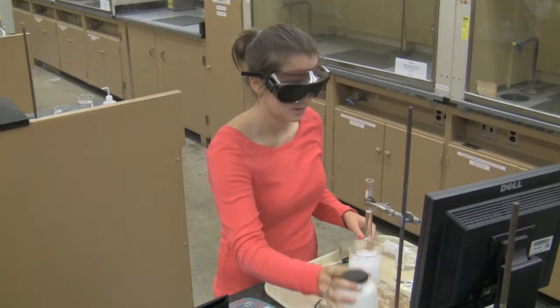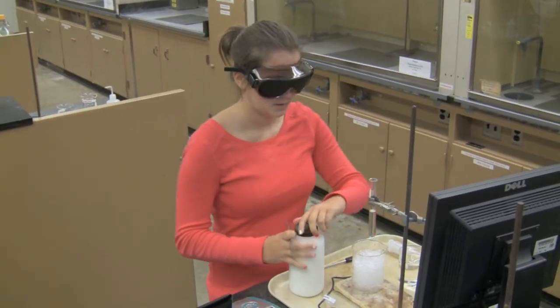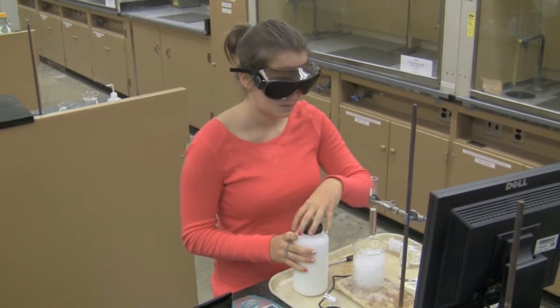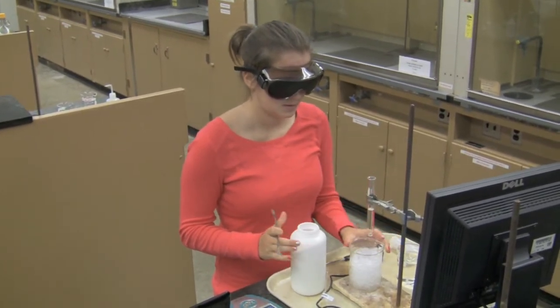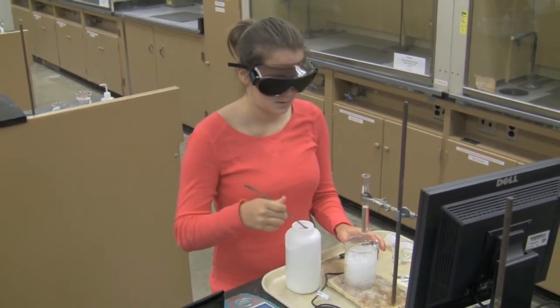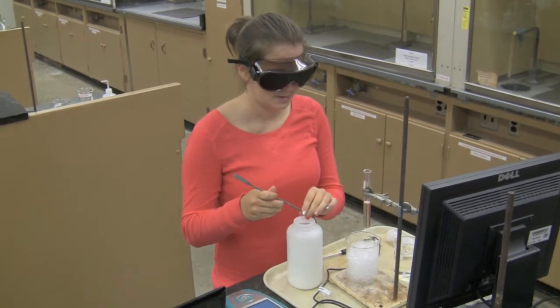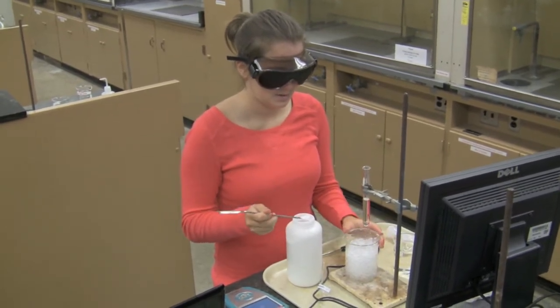A student will collect temperature data without a visual aid. She grabbed a container to her right, untwisted the lid, and is scooping three scoops of sodium chloride into a beaker of ice in front of her.